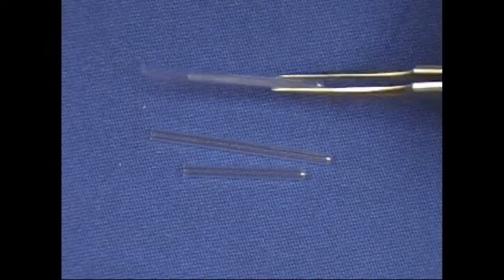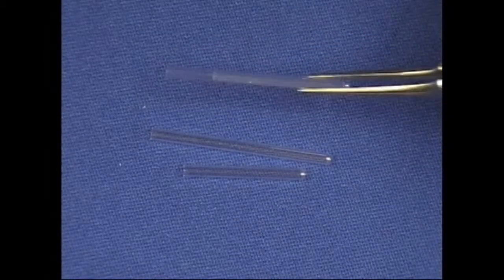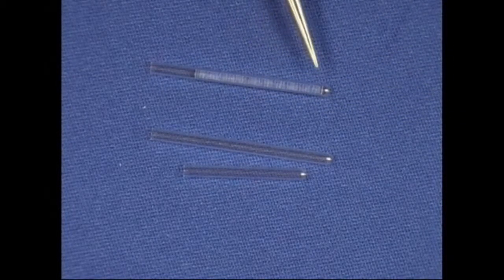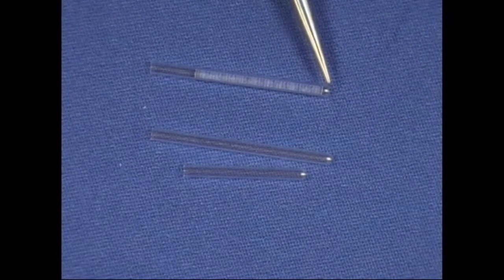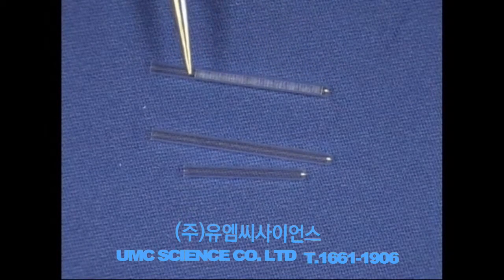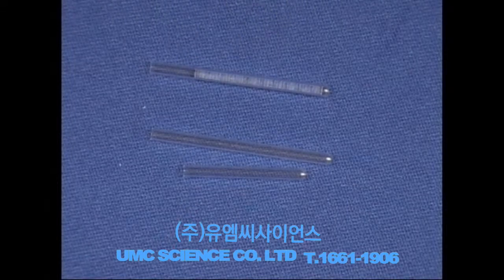This has a filler rod, this tube has a filler rod in it, and you can see that the tube, this is the bottom of the tube, and the quartz filler rod comes up to here, and then the sample would just sit on top of that, and you can put a little quartz wool on top of that if you want.